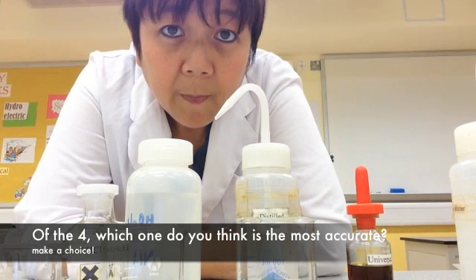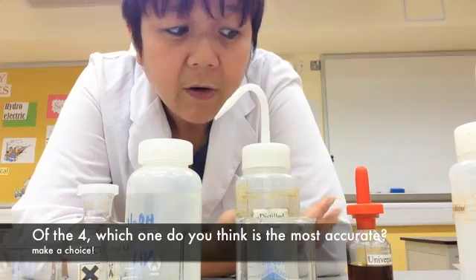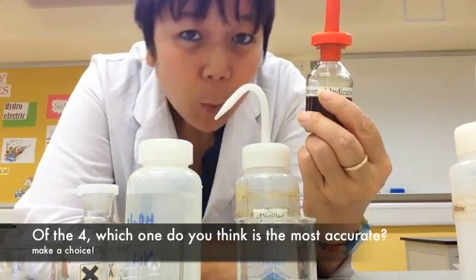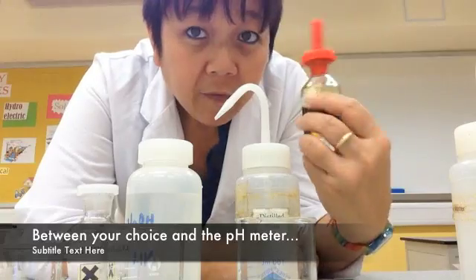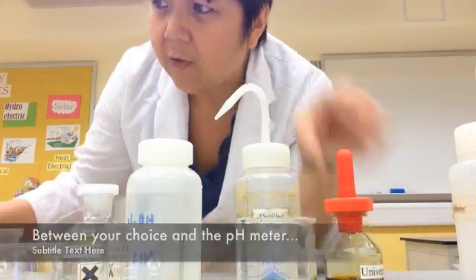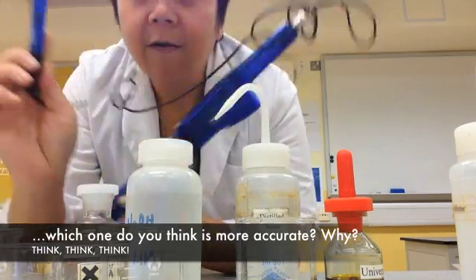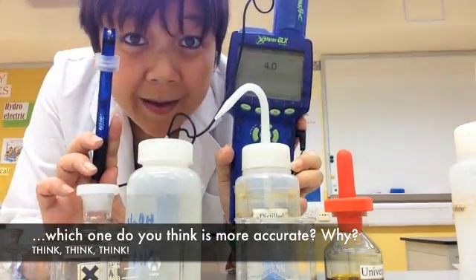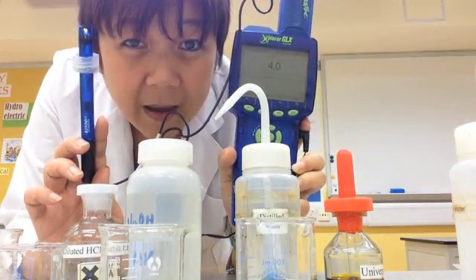So, all four — red litmus paper, blue litmus paper, yellow paper indicator, and liquid universal indicator — which one do you think is the most accurate? And after choosing from those four, which is more accurate: any of those four, or the pH meter? Think about that.